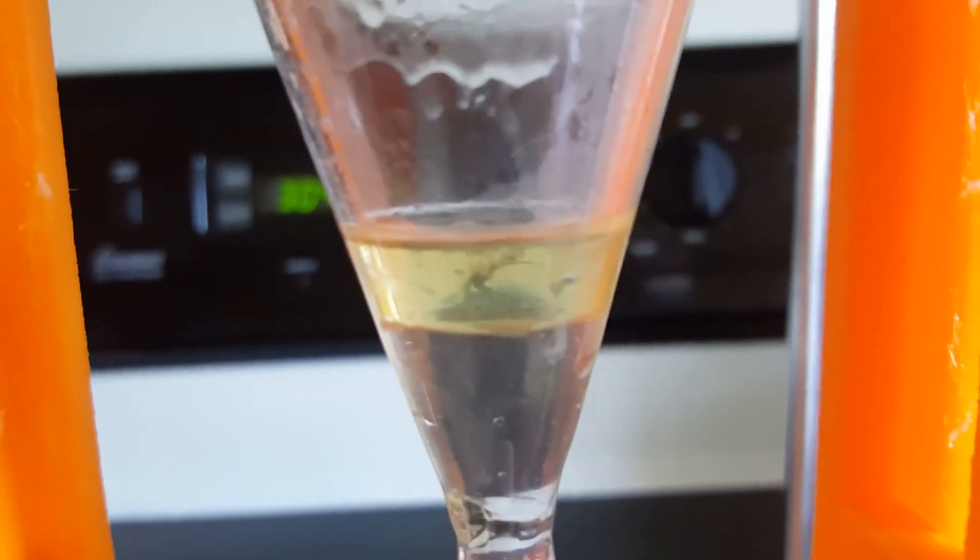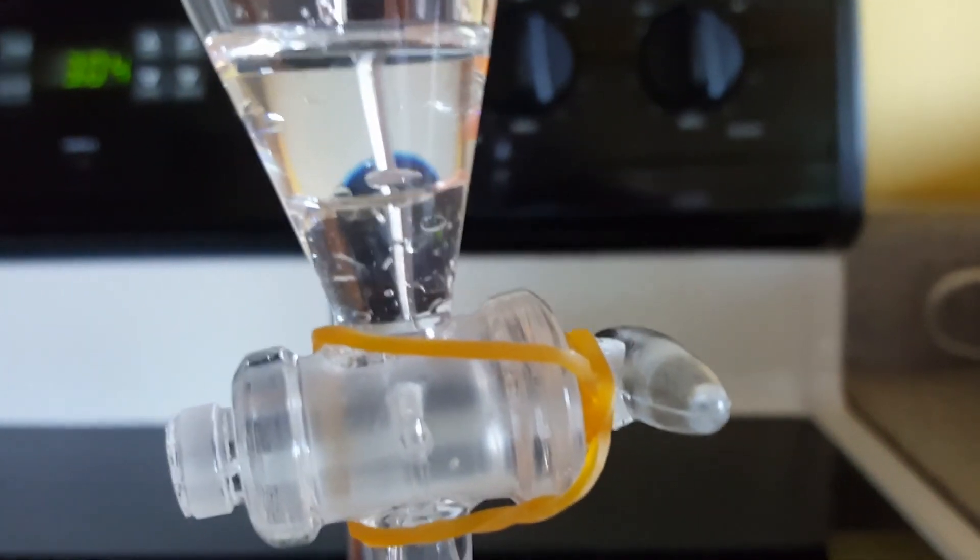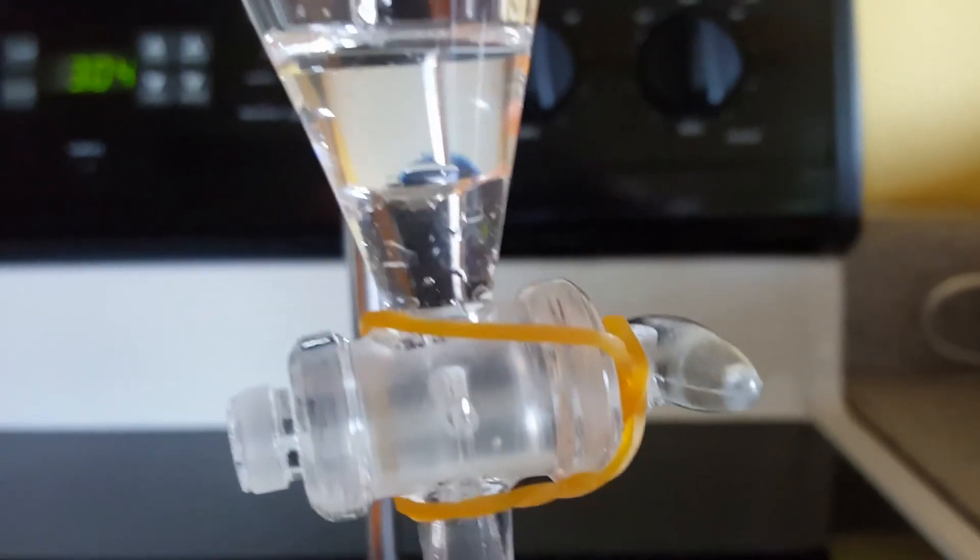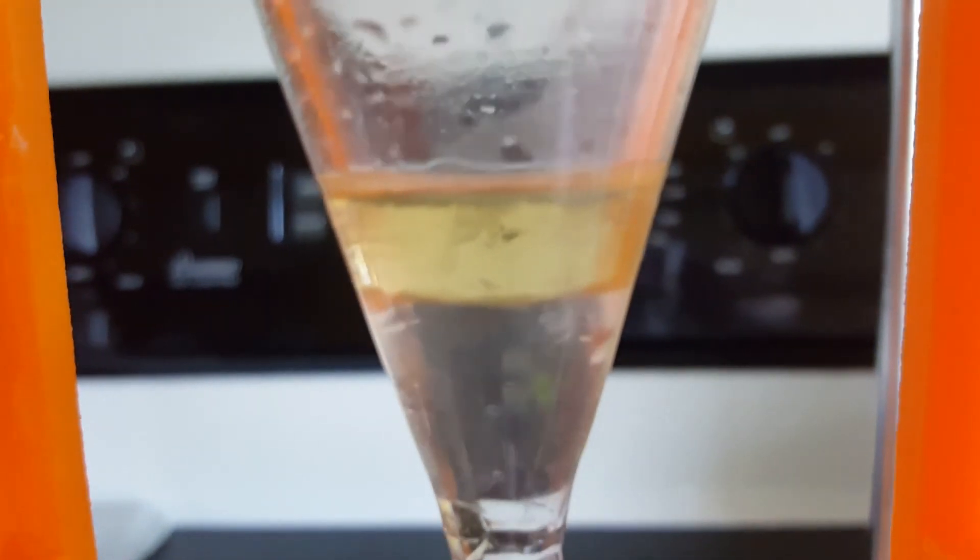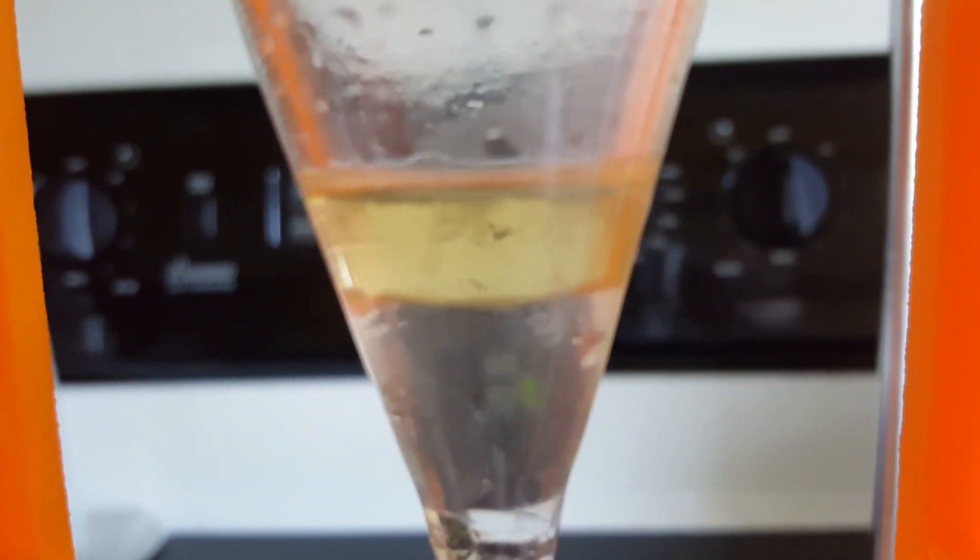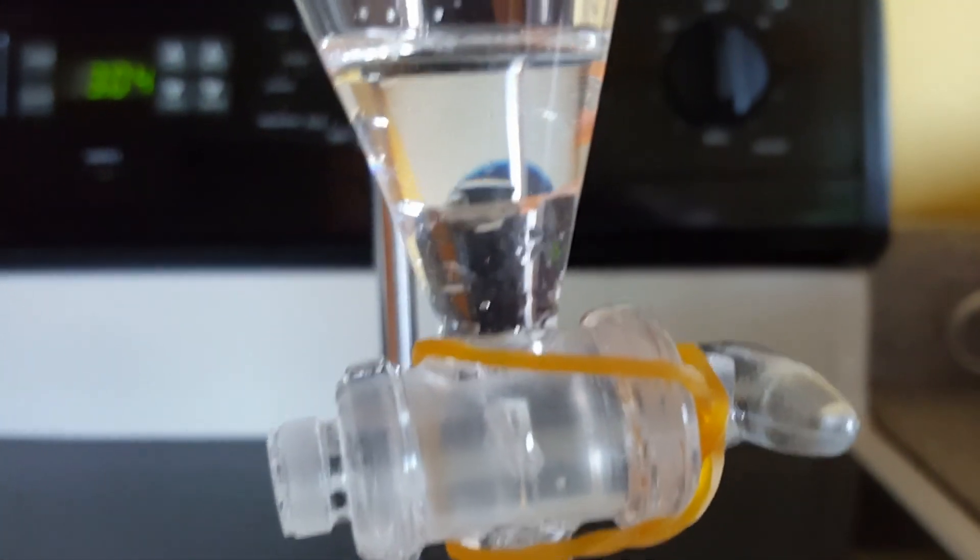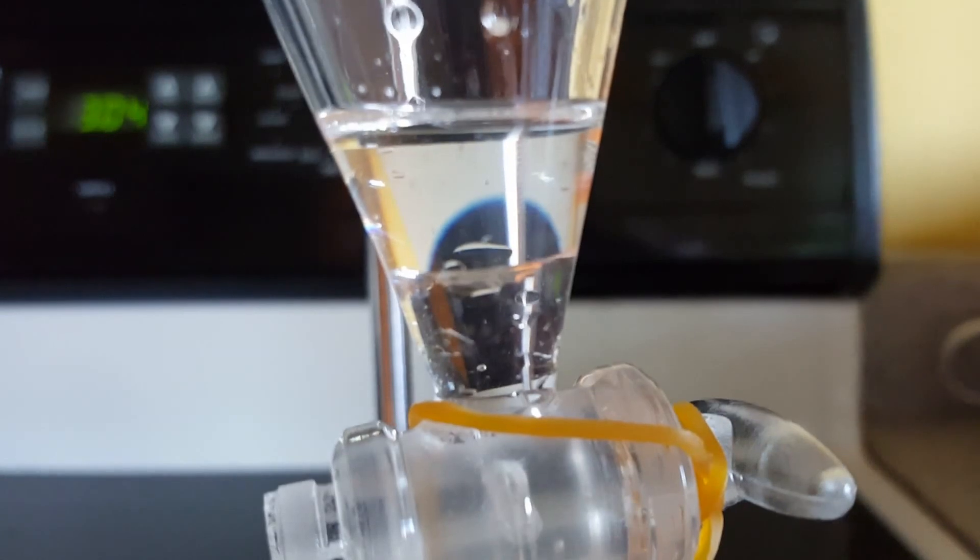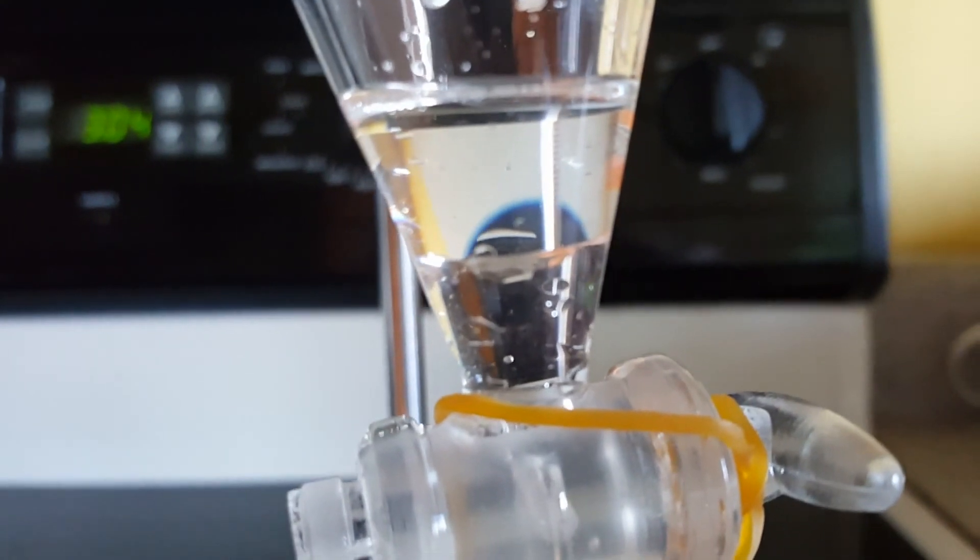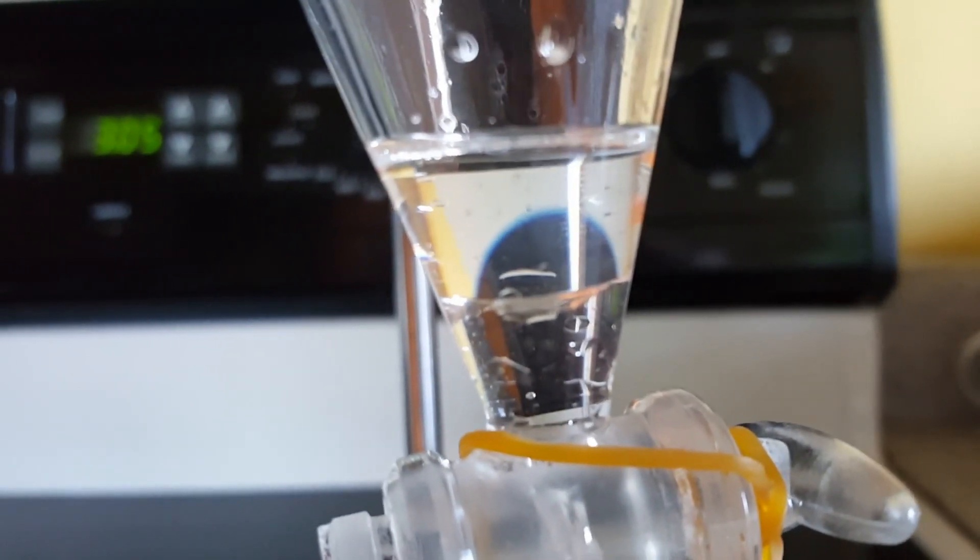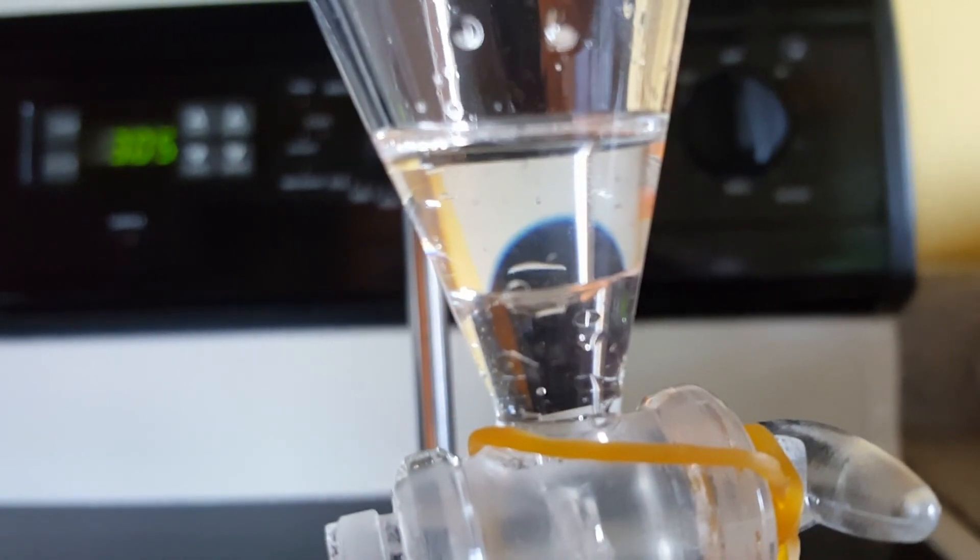I'm wondering if whatever that burnt chemical was is incorporated in this batch or whether it oxidized after sitting overnight. Now I have a dilemma of whether I should combine the two batches into one or keep them separate. They're rather small quantities, maybe 10-15 milliliters each. I don't want to contaminate my pure second batch with the first one if it was contaminated by the burning. If it just oxidized then the second batch will turn yellow also, so maybe I'll just wait a day and see if it turns yellow and then decide.